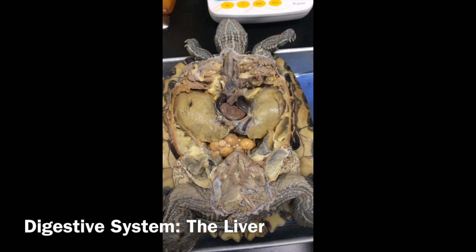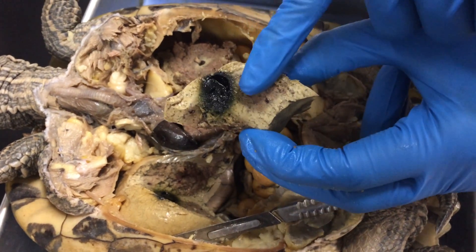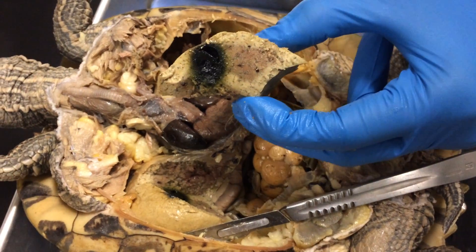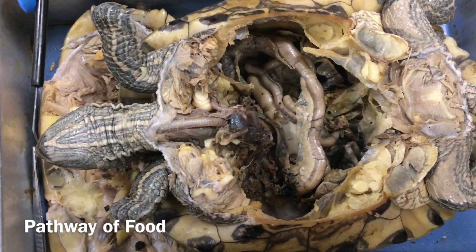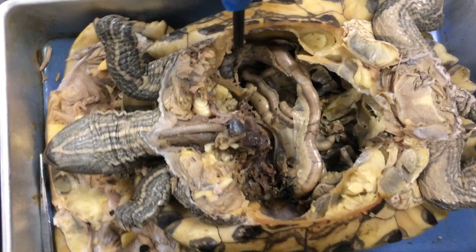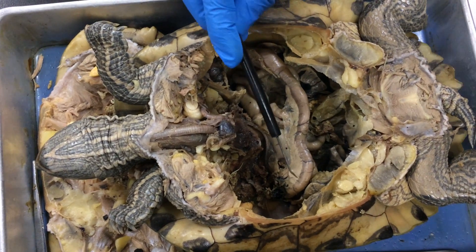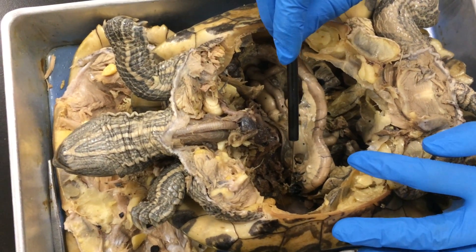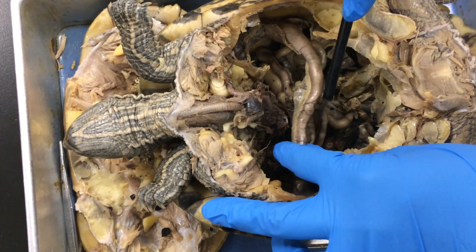On both sides, this is the liver. This is the gallbladder — it's found in the liver. It's a greenish-colored sac on the ventral left side of the turtle, and it stores bile made by the liver. After the turtle receives food, it comes from the beak into the esophagus, which is underneath the trachea, into the stomach located right here. After that, it moves into the duodenum, which is part of the small intestine. Right on top here is the pancreas, and going down is where the gallbladder is connected and where it receives bile. Then down here we're going into the large intestine.